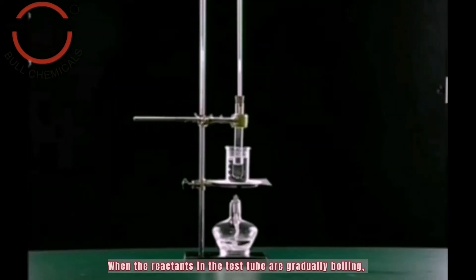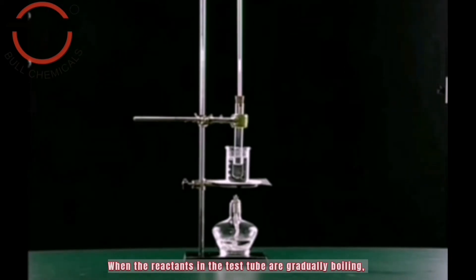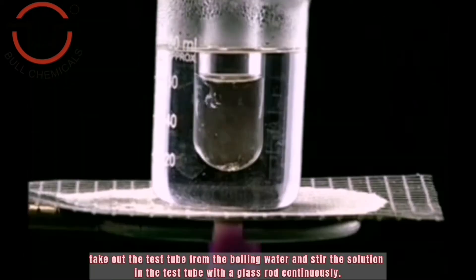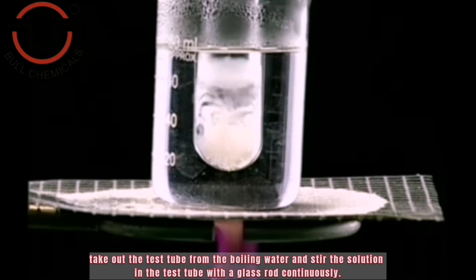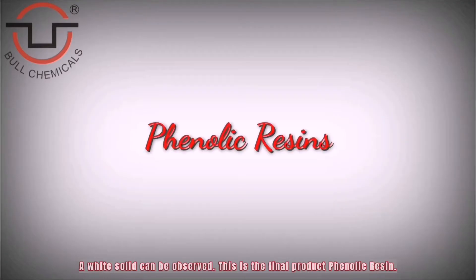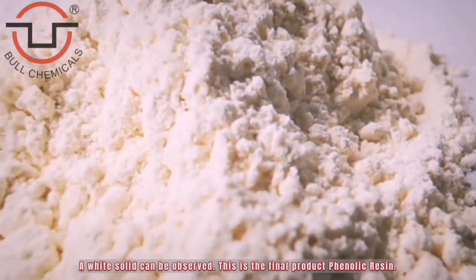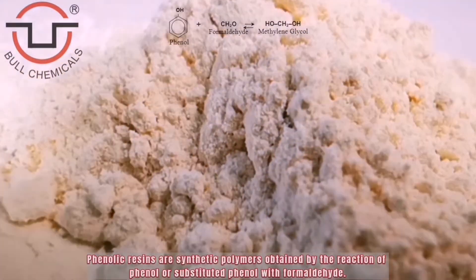When the reactants in the test tube are gradually boiling, take out the test tube from the boiling water and stir the solution in the test tube with a glass rod continuously. A white solid can be observed. This is the final product — phenolic resins.